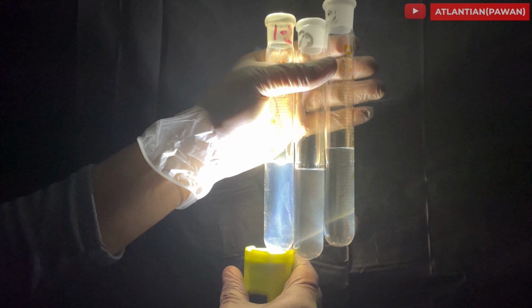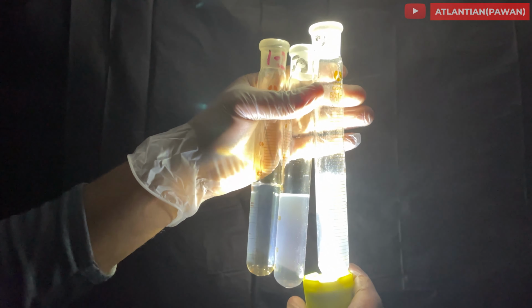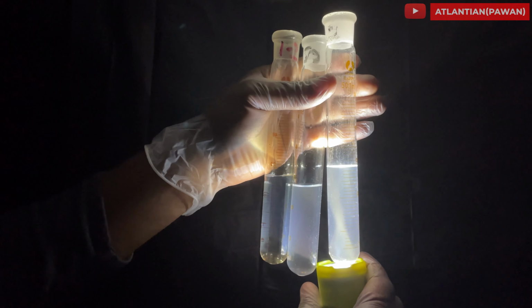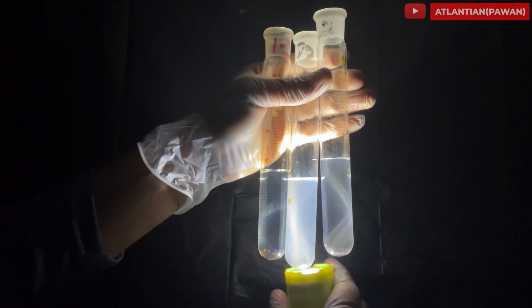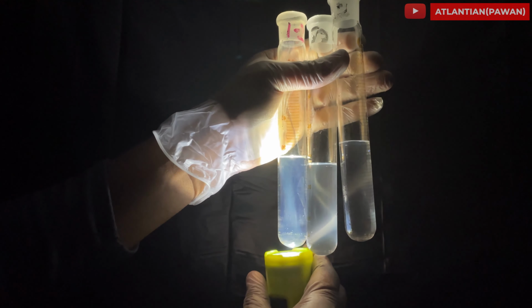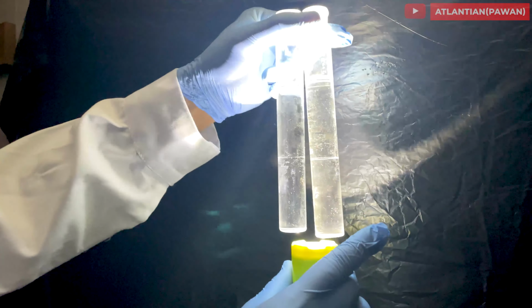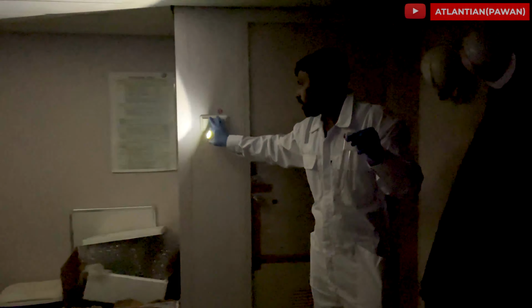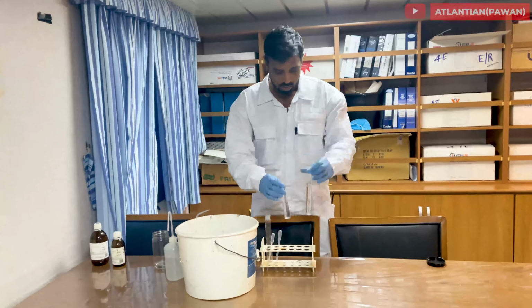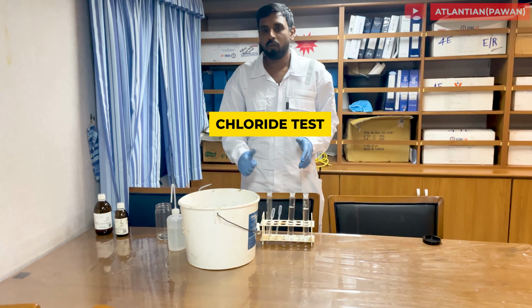So let me just switch off the light. Here you can see how distinguishably they are seen: 1 to 2 FTU, 50 FTU and 100 FTU. So this is just to see how much impurity is present in your tank. So we'll continue to wash our tanks till our tanks are hydrocarbon free. Once our tanks are free of hydrocarbons, then we'll move to the second stage.